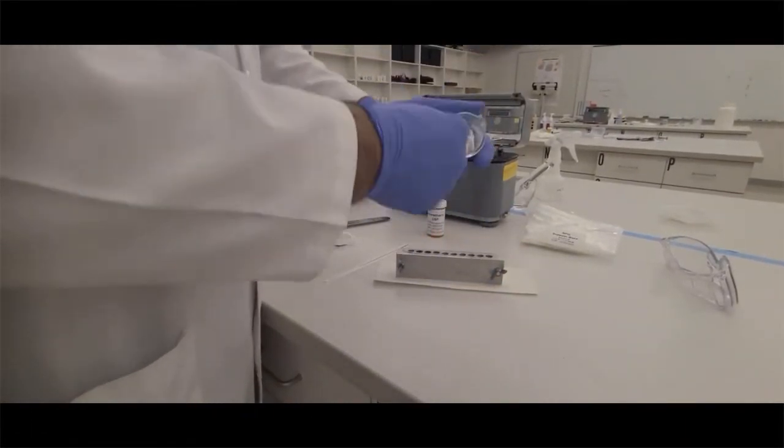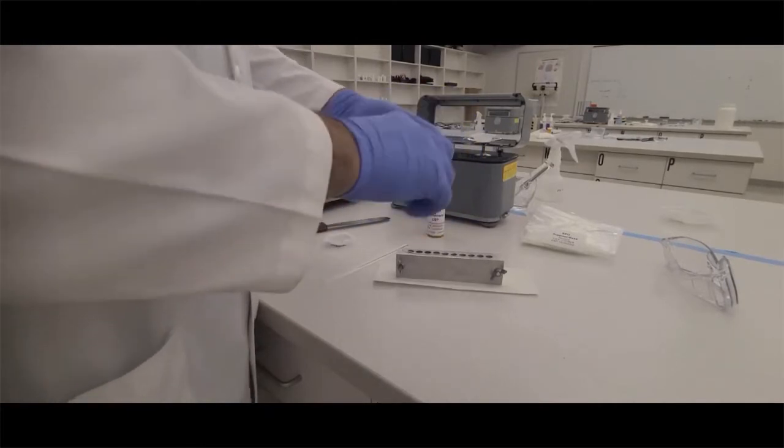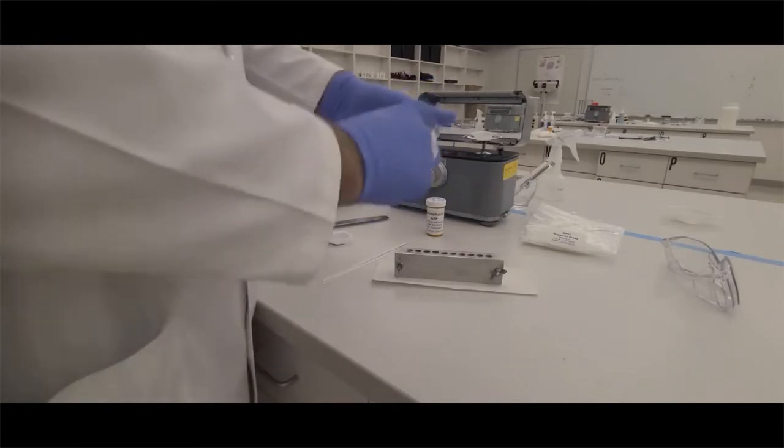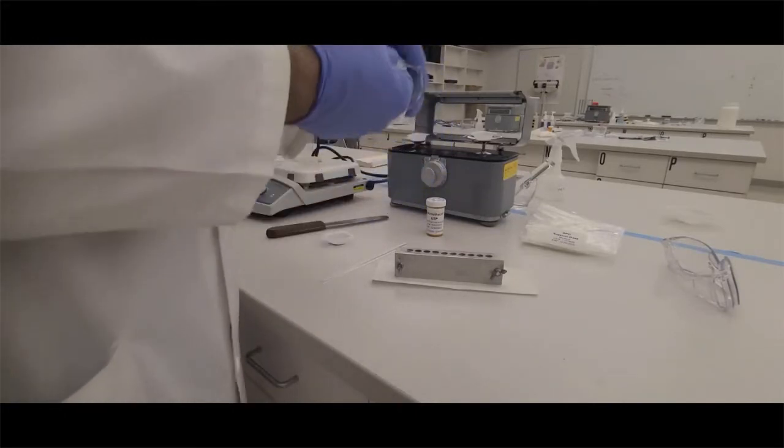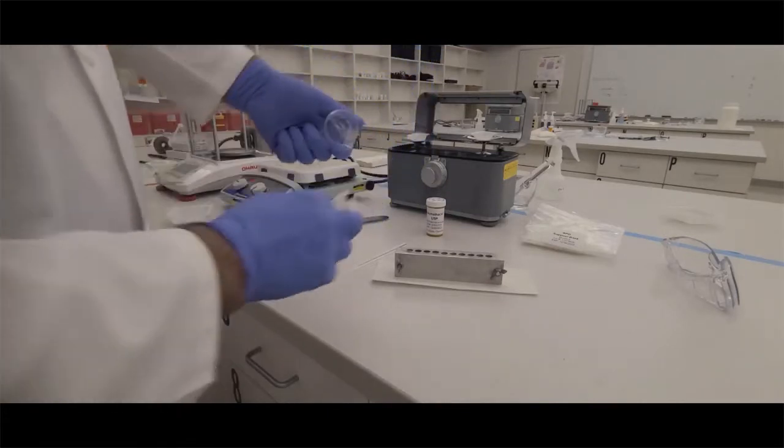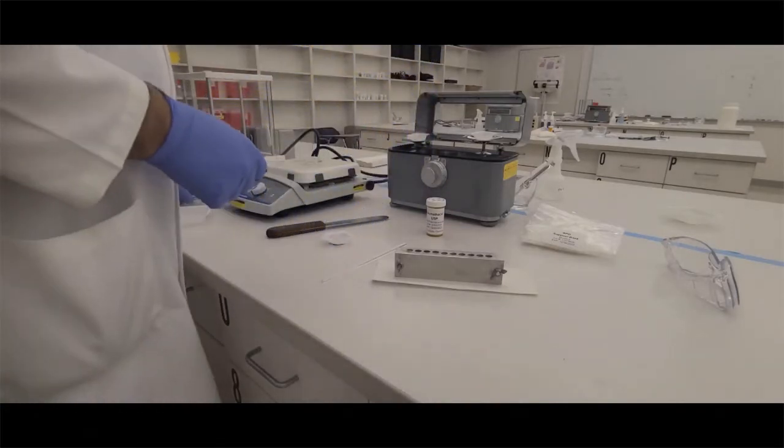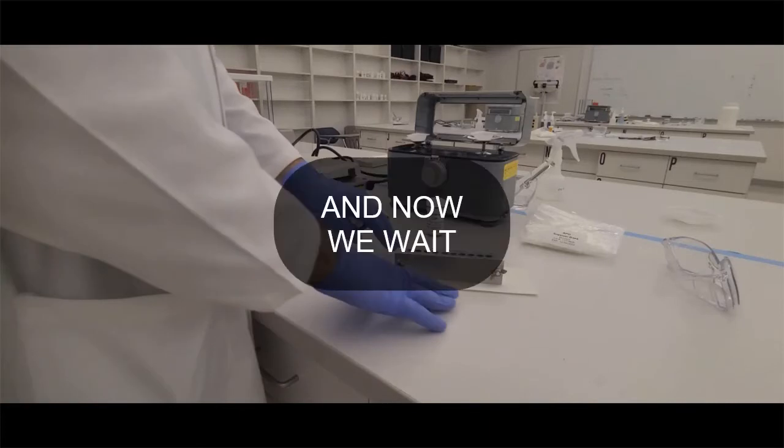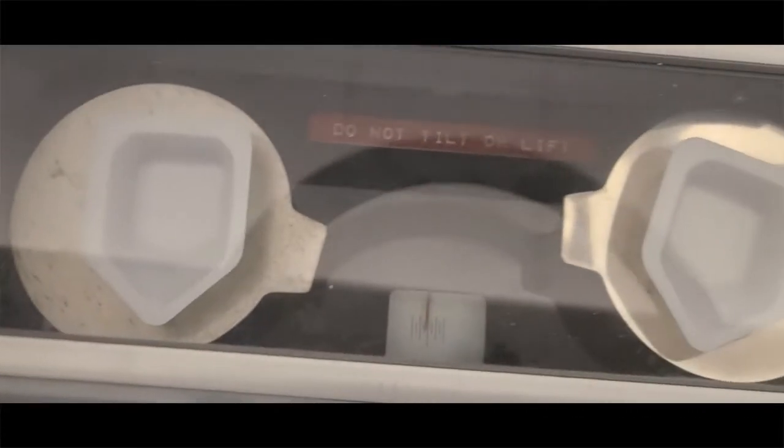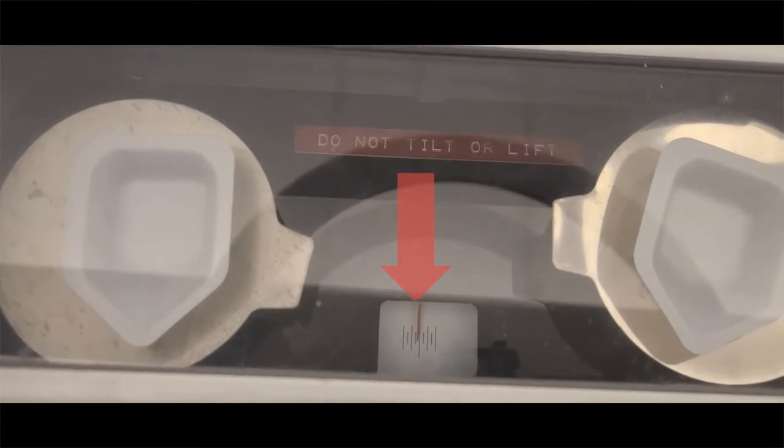Right now is a good time to clean out the beaker. If you do it when it's cold, that base will be very difficult to clean. So clean it now because we're going to use this beaker again. Once that beaker is clean and we have three suppository wells filled, we're going to be waiting for this to solidify. We're going to use the torsion balance and weigh out our drug.